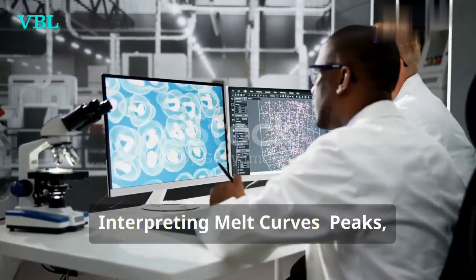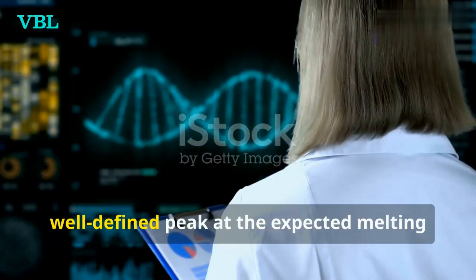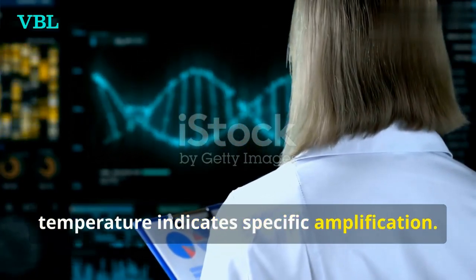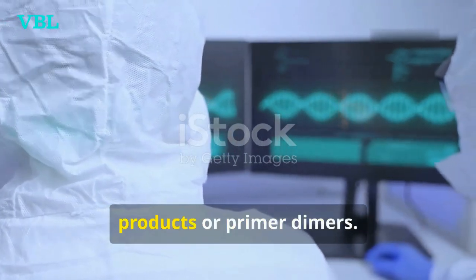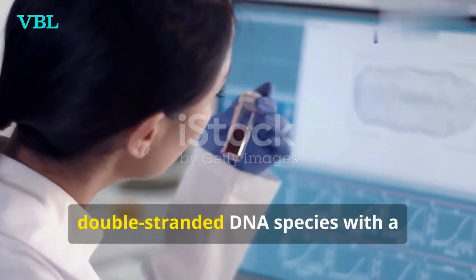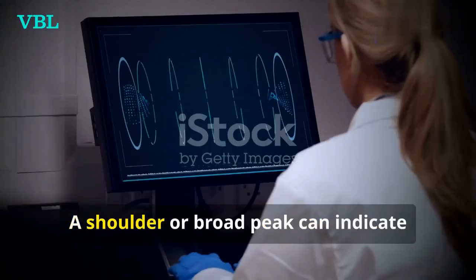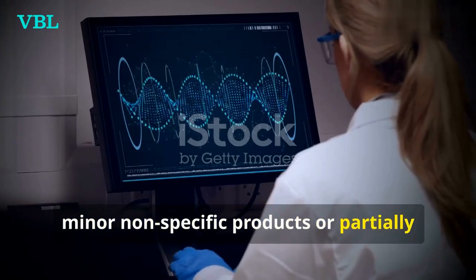Interpreting melt curves: peaks, shapes, and specificity. A single, well-defined peak at the expected melting temperature indicates specific amplification. Multiple peaks suggest non-specific products or primer dimers. Each peak represents a distinct double-stranded DNA species with a different melting temperature. A shoulder or broad peak can indicate minor non-specific products or partially degraded DNA.